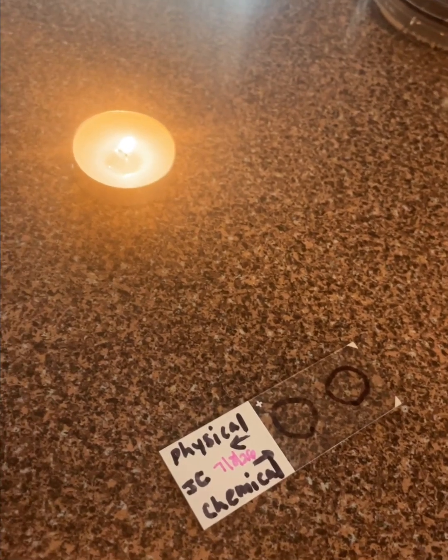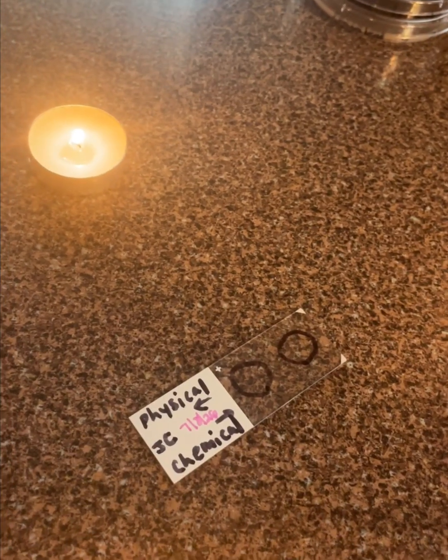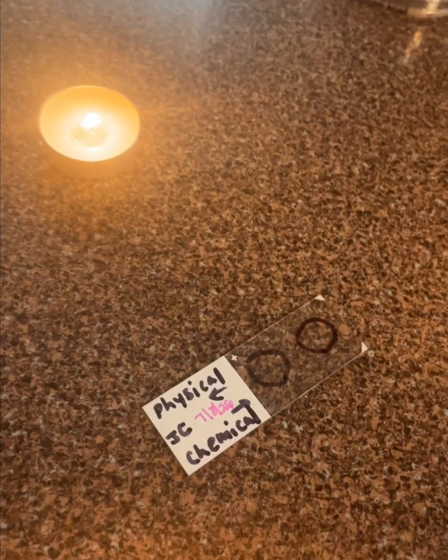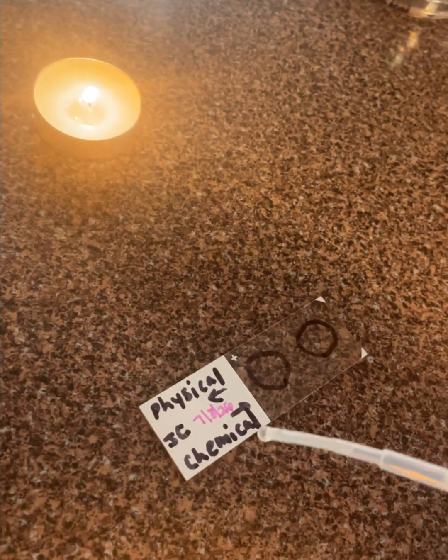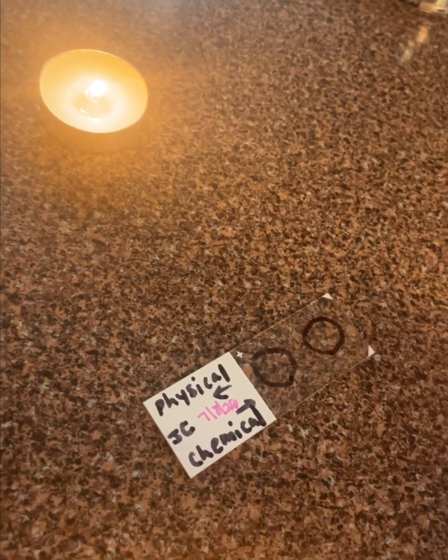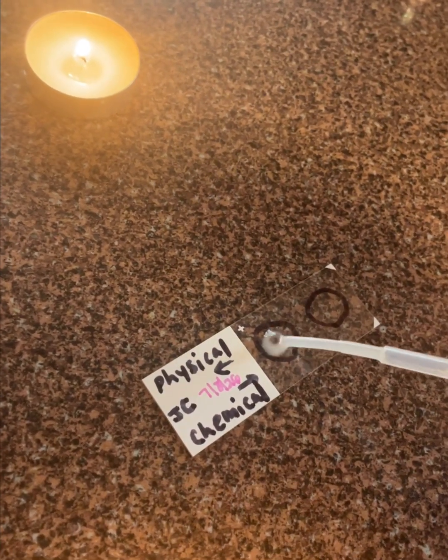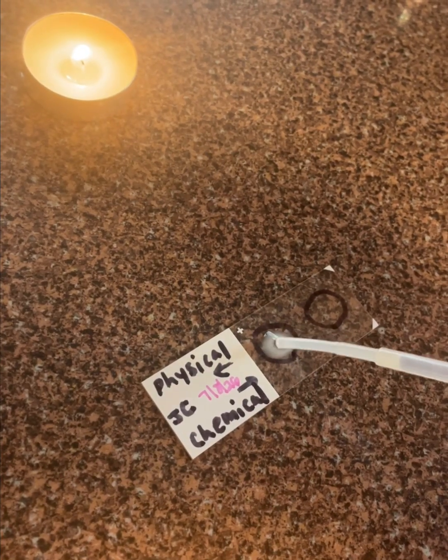Now that my physical method has cooled and I've waited the 5 minutes for my chemical method, I'm going to put them on a slide. So my physical, which was my boiling, is going to go on the left side. I'm going to try to get this bubble out of there.